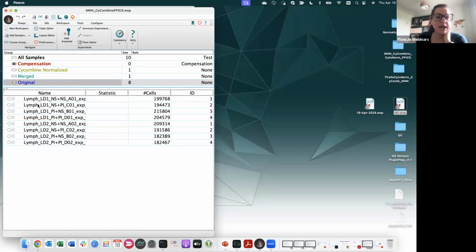So I have my 8 samples, originally my 4 controls and 4 respective samples in the 4 different batches.